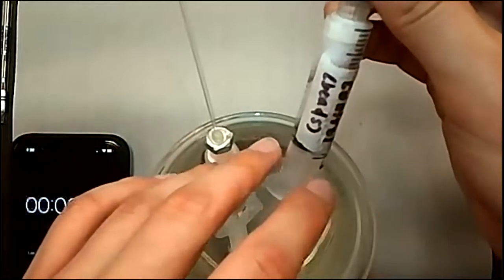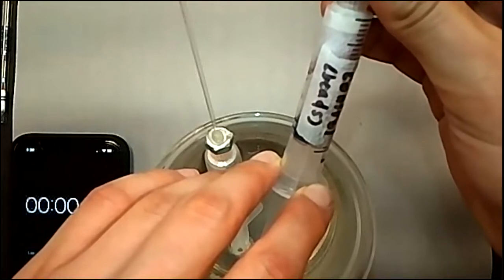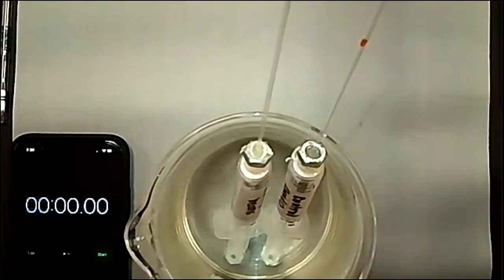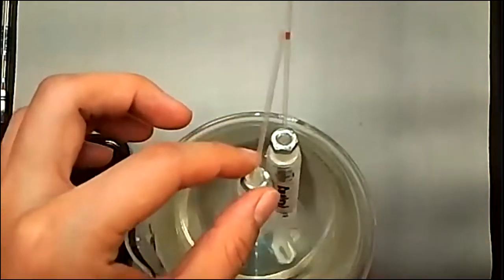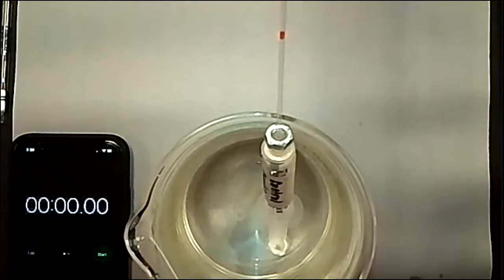So I'm going to have to push it outwards first to make sure that it's at least at halfway at the temperature that it's being held at in the colder water than my hands. Sorry, I should have warned you for the bell ringing. So we'll mark that after. So let me do the same for the mung bean one, and then we will go ahead and start the data collection.